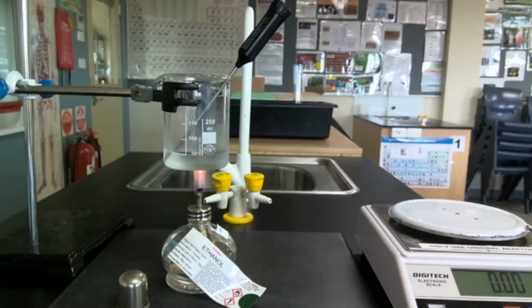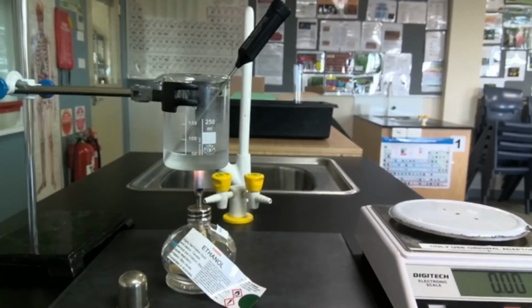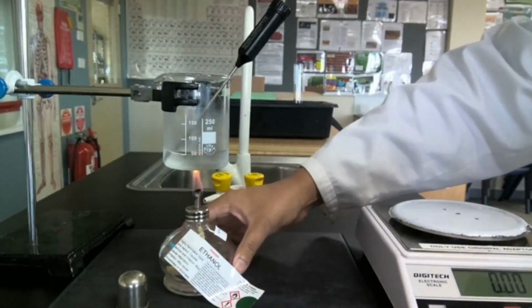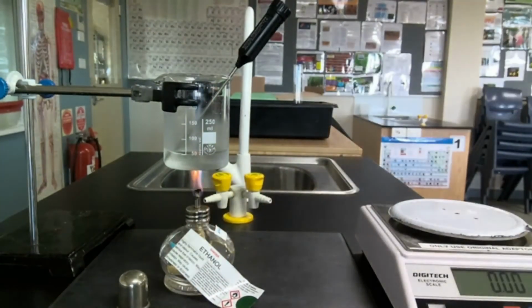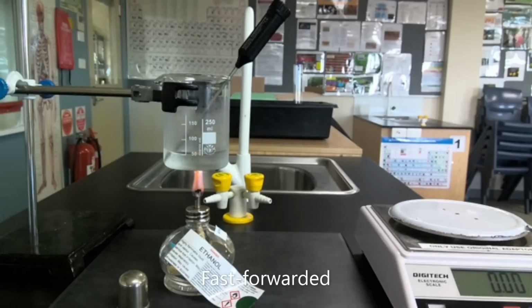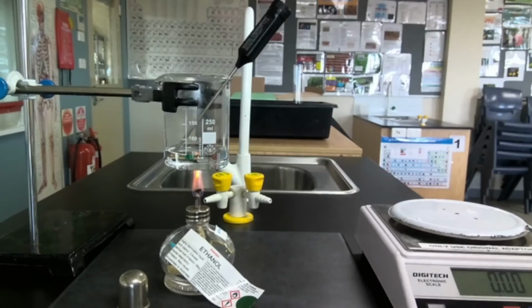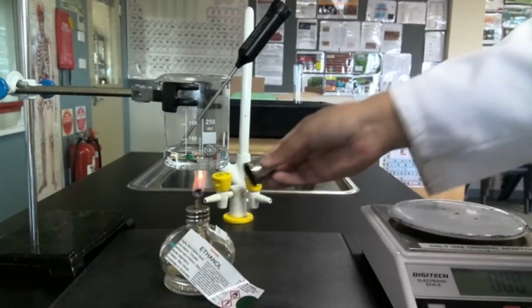It doesn't actually matter how long we burn this fuel for. What is really important is that we are seeing the majority of that heat actually heating up that beaker of water. Okay, that should be time.